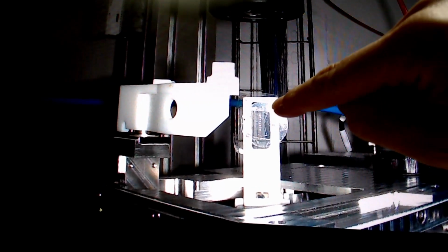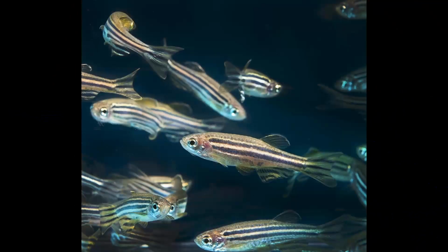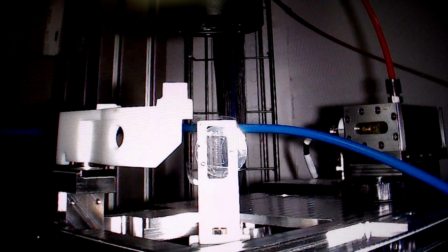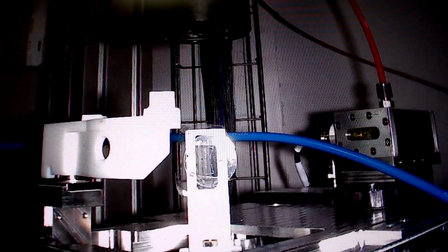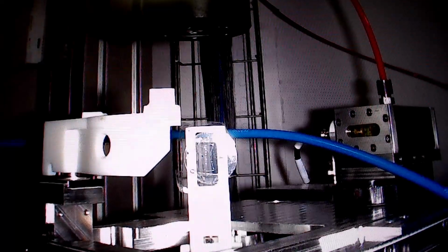And over here you may actually see tiny white dots. Each of them is a head of the zebrafish, and we choose one of them and we scan this head in the beam, which allows us to detect different elements in the zebrafish head.